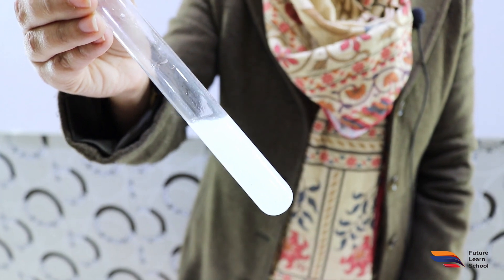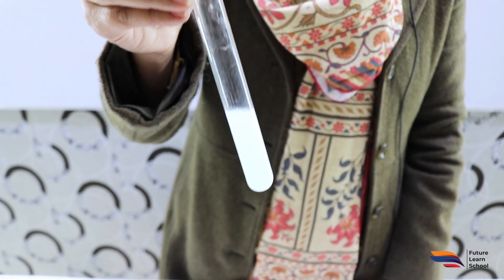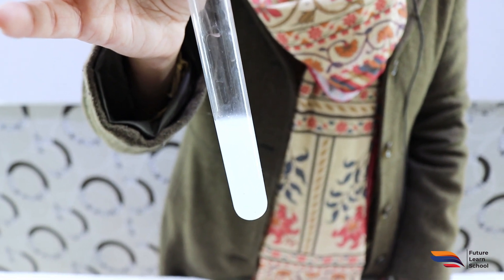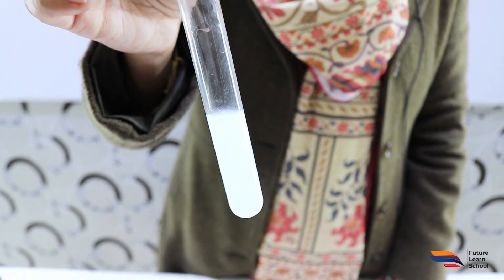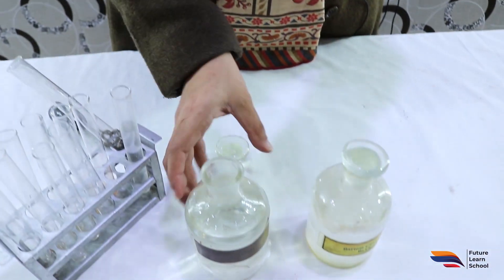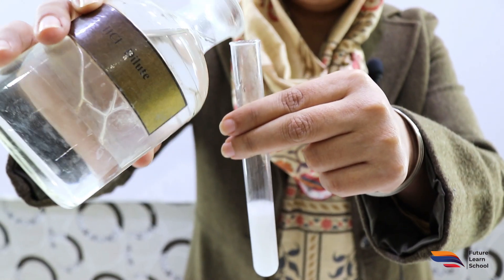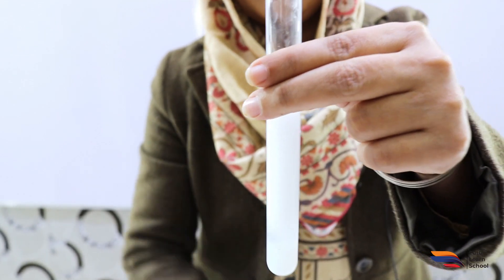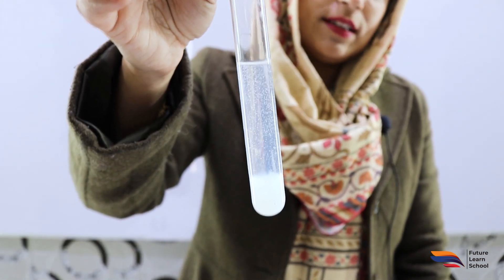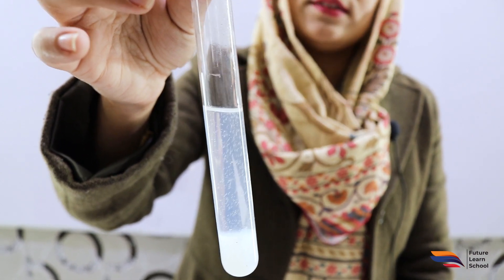To further identify the Group 1 radical, we add dilute hydrochloric acid to the original precipitates. Here you can see that a gas evolves with effervescence. This effervescence indicates that we have a carbonate radical. Based on this scheme, the carbonate radical is indicated in our salt.